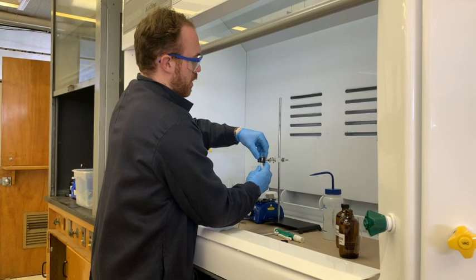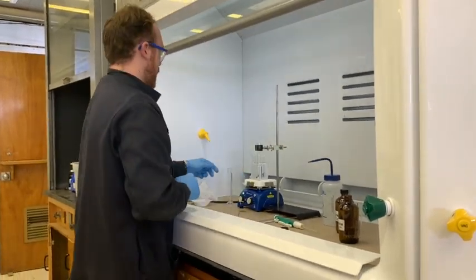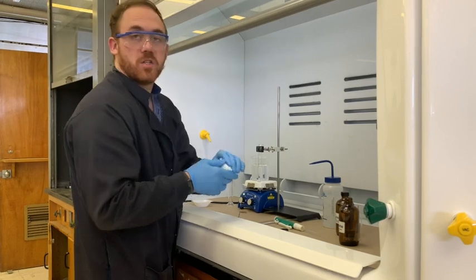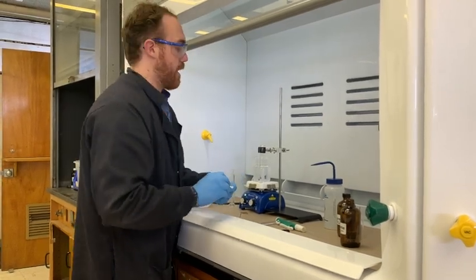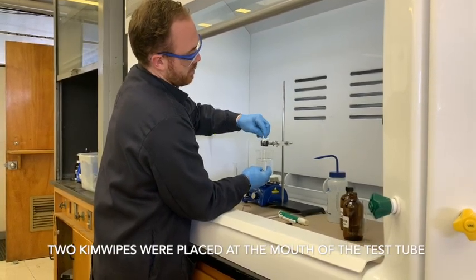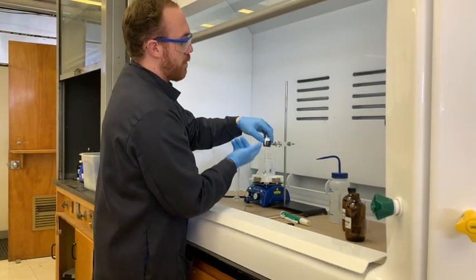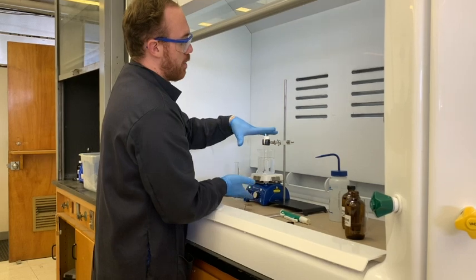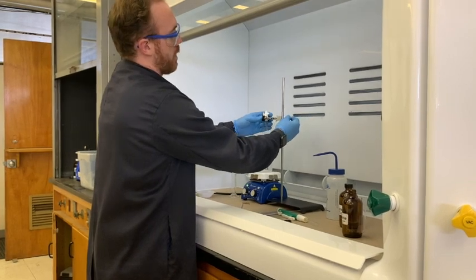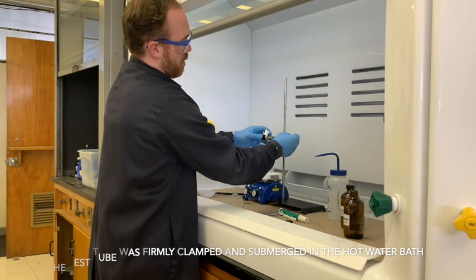Alright, so you want to clamp this firmly in place, and you're going to take just a wad of dry paper, in this case we're using just a couple of kim wipes, make sure that they're securely fastened and they're not going to slide down. You're going to put them into this tube. Paper is nice because it can also allow air permeation, air is not going to build up too much back behind it and it's not going to block gas release.